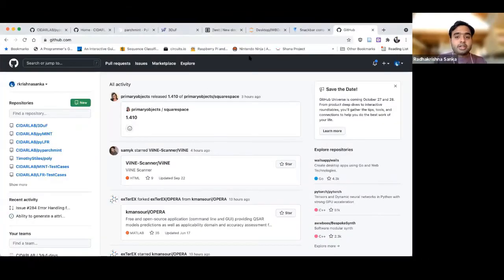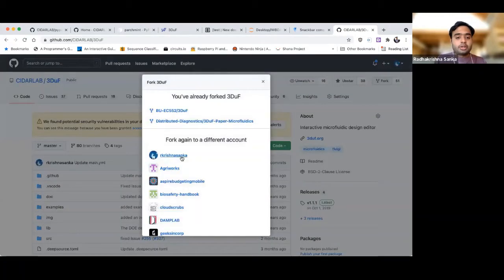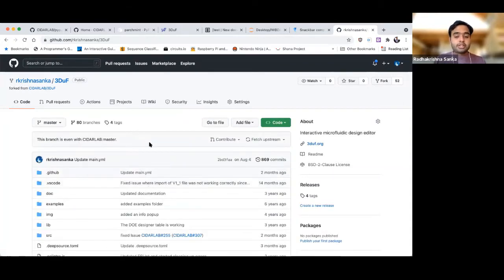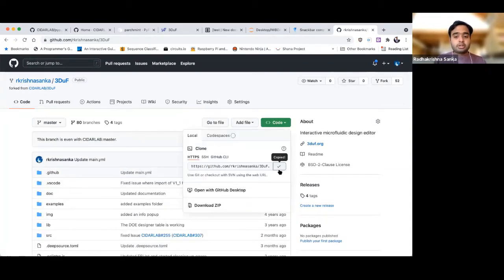So we've had some more folks join in. I was just talking about forking the repository and stuff. I will show that from scratch right now. I will fork it live and show you how that goes. So if you're planning to work on 3DUF and you want to extend it, first go to the repository, then hit fork. You can pick any of your accounts. Once you fork the repository, it'll probably take a couple of seconds. At this point, you want to clone it onto your console.